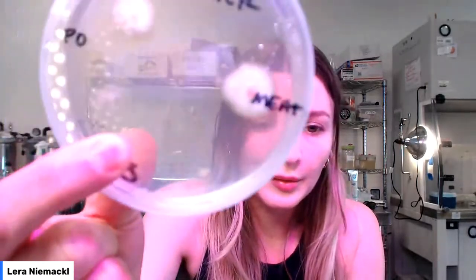So this is the clone — the king oyster. Remember that big meaty mushroom? After one week, this is about how grown it is, and that's normal. Even a little bit bigger would have been totally reasonable, but it obviously depends on the size of your tissue culture as well. If any of you guys did that the day of or the day after, you should definitely see some tissue. This little bubbly area right here — that's just the agar. It's kind of difficult to work with the malt extract agar with a microwave; if you were to autoclave, you'd get a lot more cleanliness. How can I tell that that's not contaminated? It just hasn't grown since. The day that it settled, it had that little colony of bubbles and it hasn't adjusted. You also totally get an idea for bacterial and fungal contamination, but you shouldn't see bacterial contamination because there's antibiotics in the media.